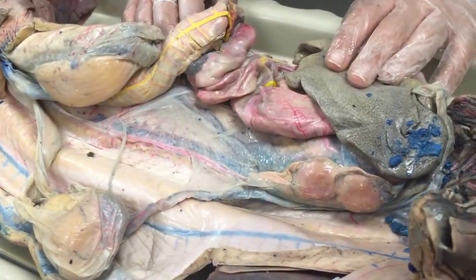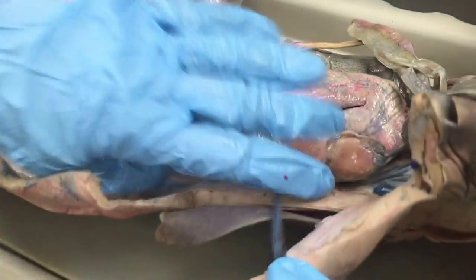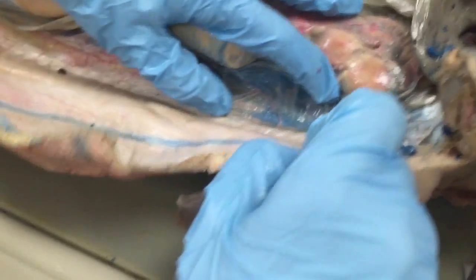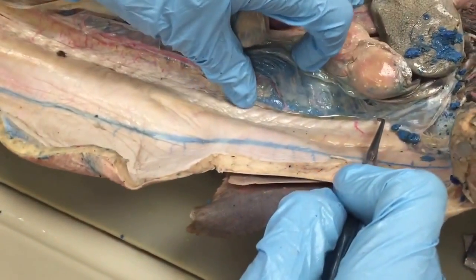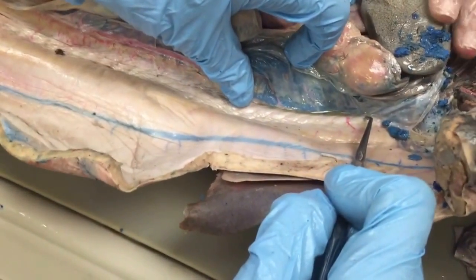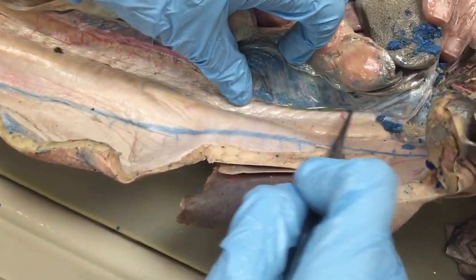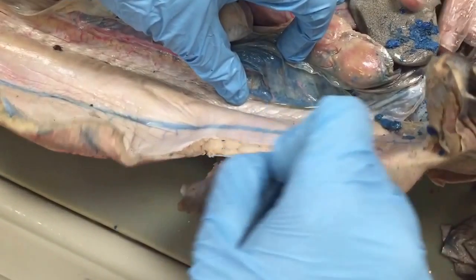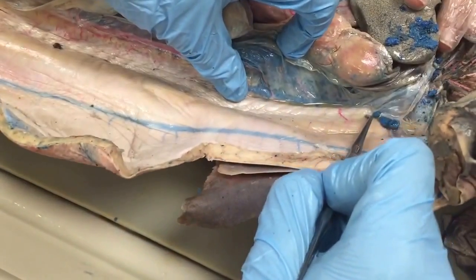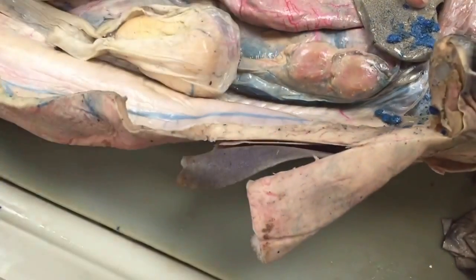How about the top section of the kidney here? The top section — it doesn't have a name in the female; it's just non-functional tissue. In the male it does have a name — for the male it's the Leydig's gland, the top third.